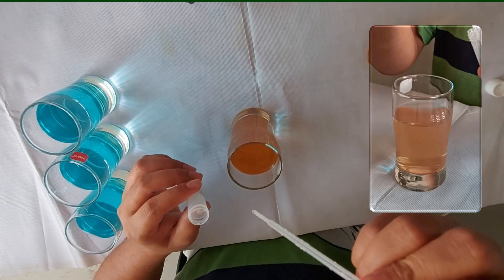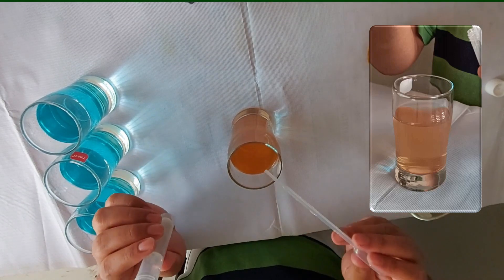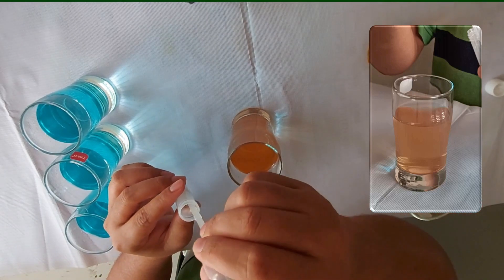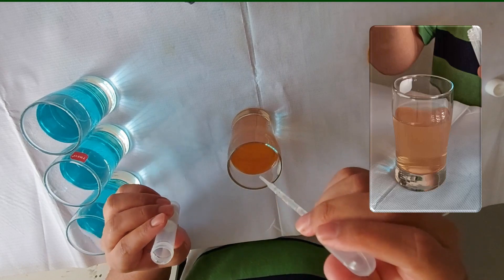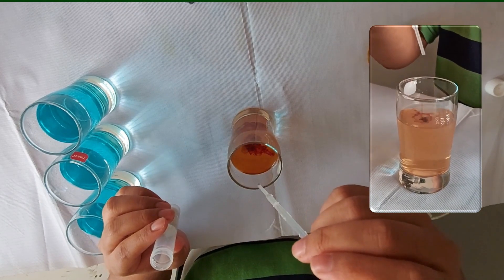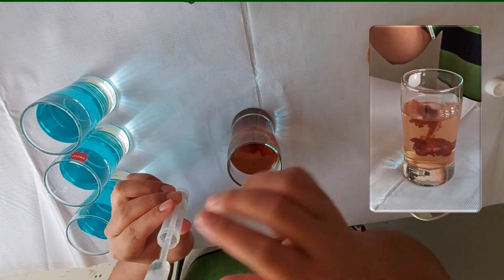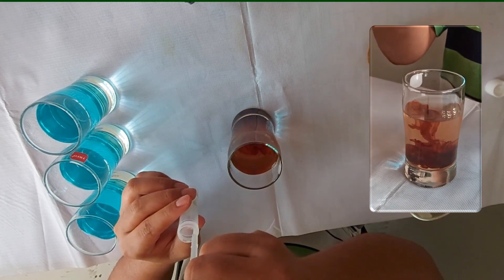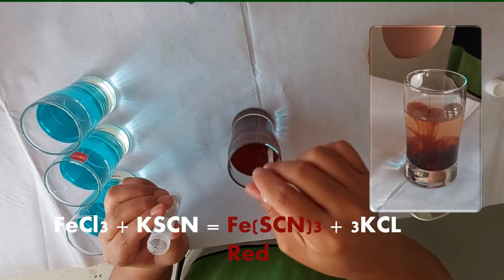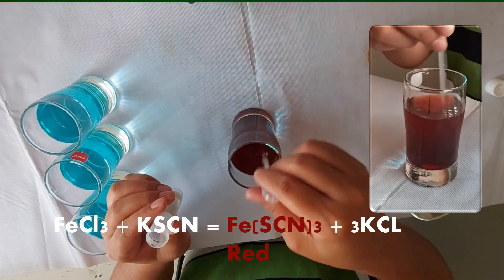We will see the red color. For that we have to add potassium thiocyanate to the ferric chloride solution. Let's add it and take it by dropper. You see, even one drop causes a very nice red color. You see this came out as a very nice red color — blood red color.